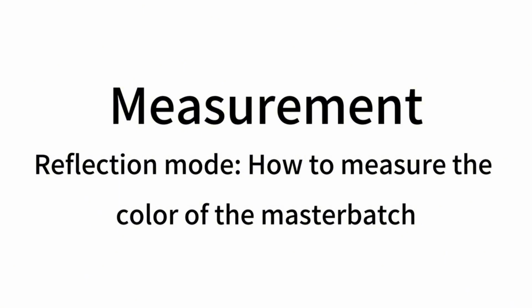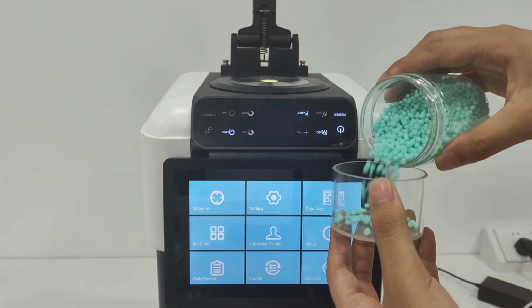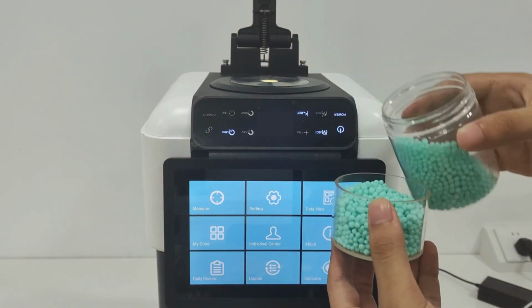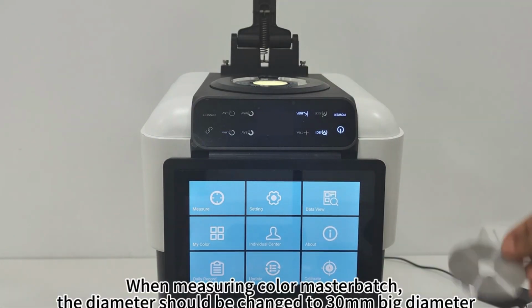Measurement. Reflection mode. How to measure the color of the master batch. Pour the color master batch into a circular cuvette. Try to fill it up. When measuring color master batch, the diameter should be changed to 30 mm big diameter.